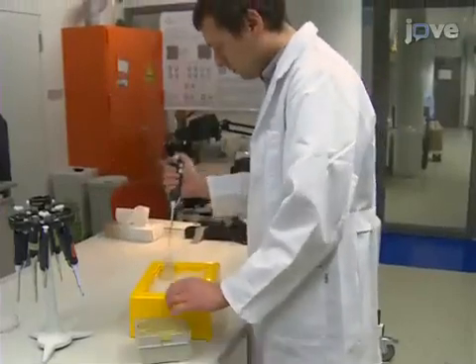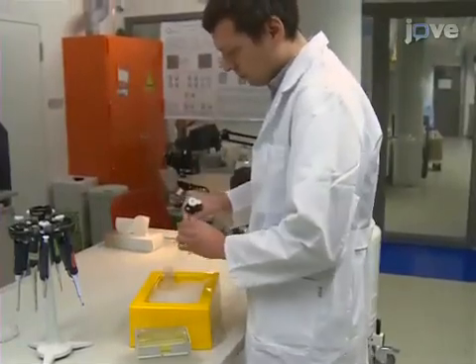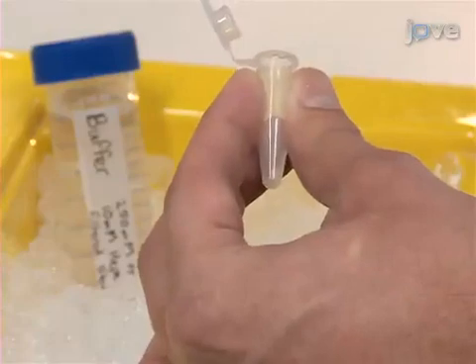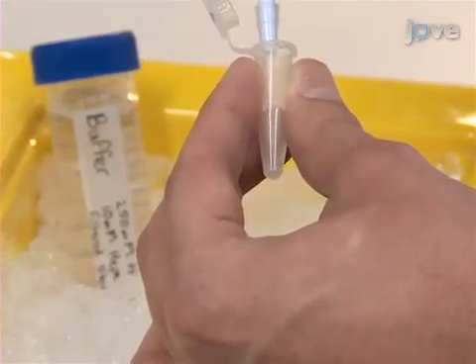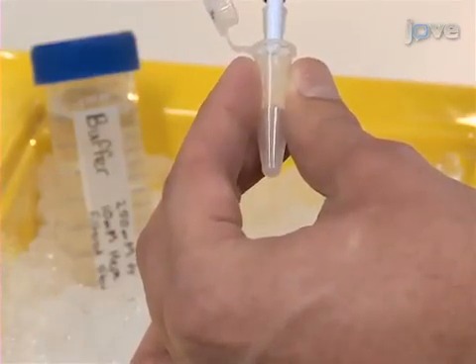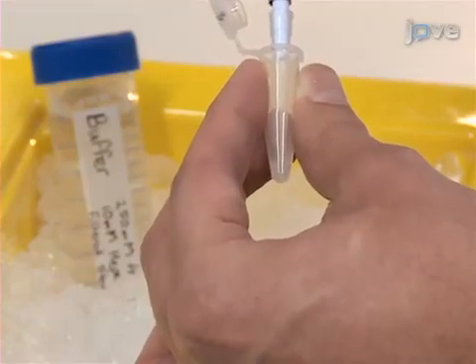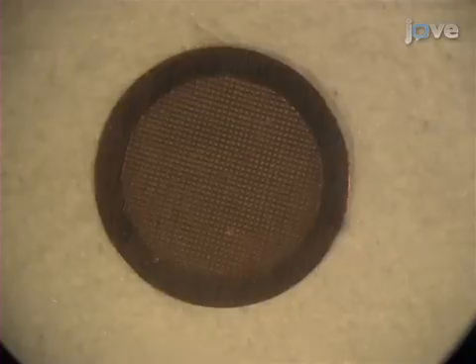After isolating and pelleting mitochondria according to the text protocol, use 250-millimolar trehalose and 10-millimolar HEPES buffer to re-suspend the pellet to a concentration of approximately 5 milligrams per milliliter of total protein. Glow discharge holey carbon EM grids.